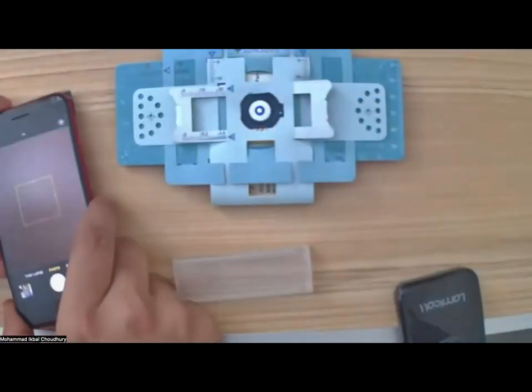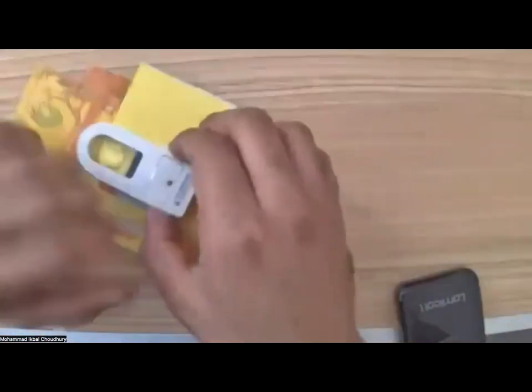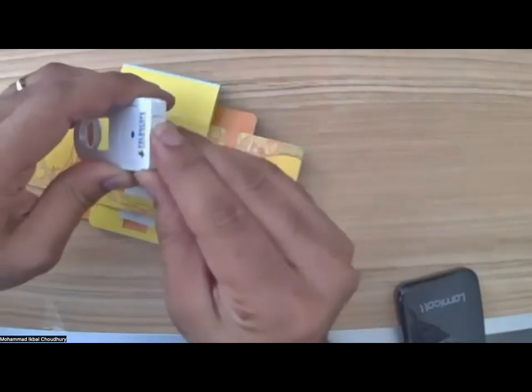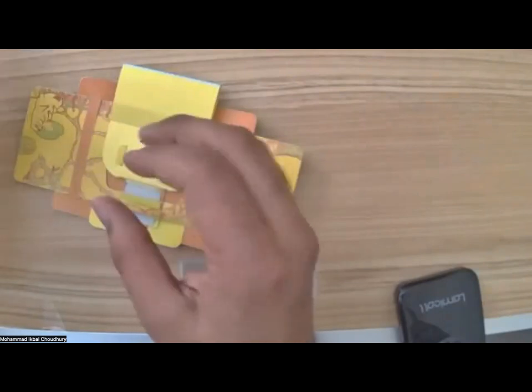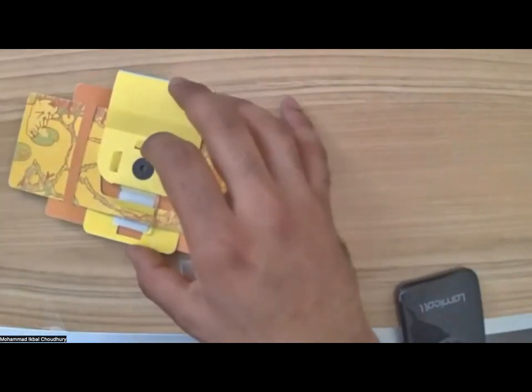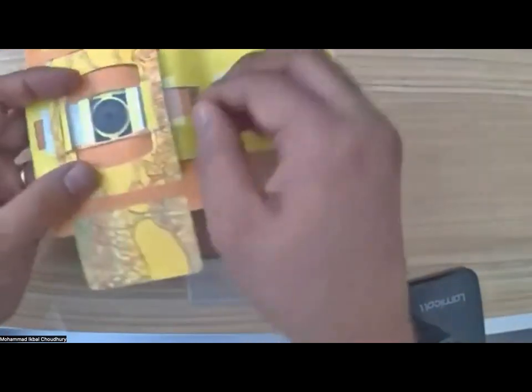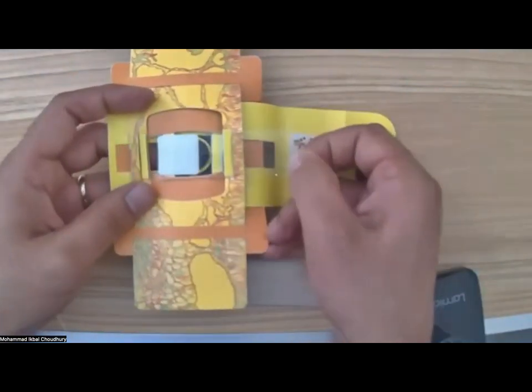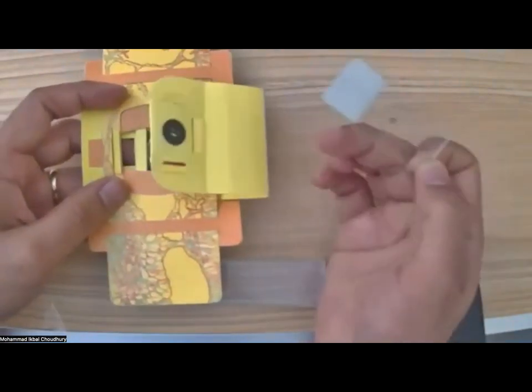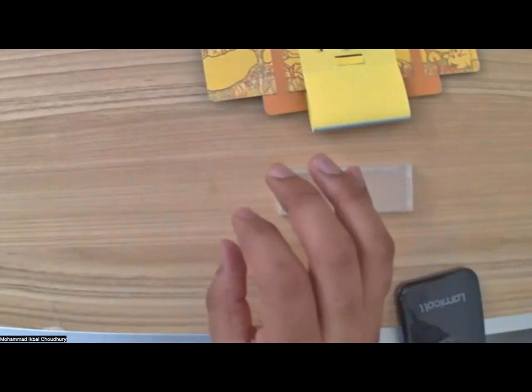Now, let's try to make a sample here so that we can cover the workshop completely, all the contents of the workshop. I'm just closing the light because it uses a battery, and there's no point using up the battery unless you are visualizing or taking an image. So I'll take this slide out like that. So far, I'm assuming everyone has become good at putting slides in and out of the foldscope. Let's leave the foldscope for some time. Let's bring in a new slide.